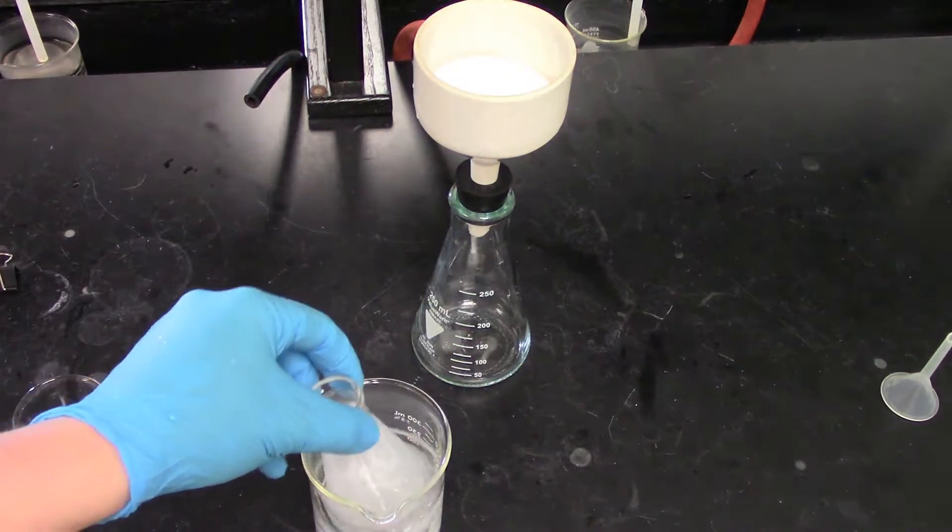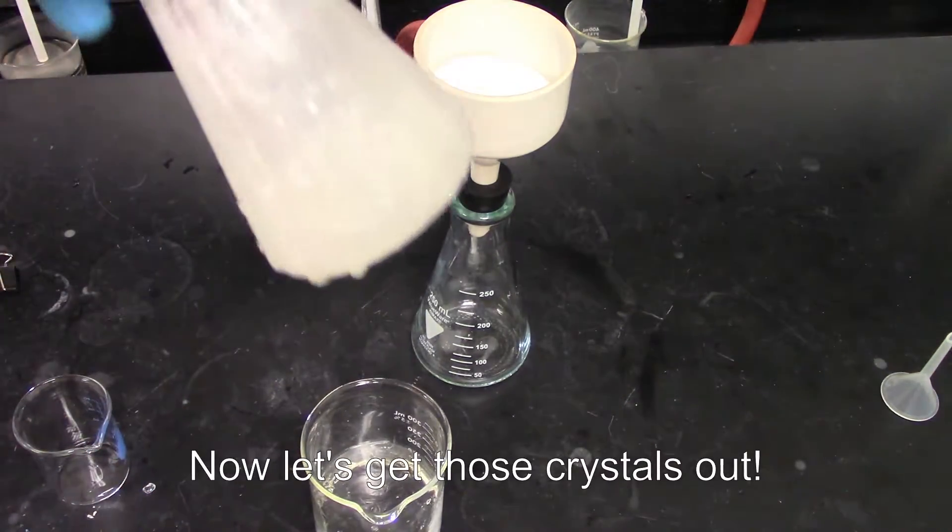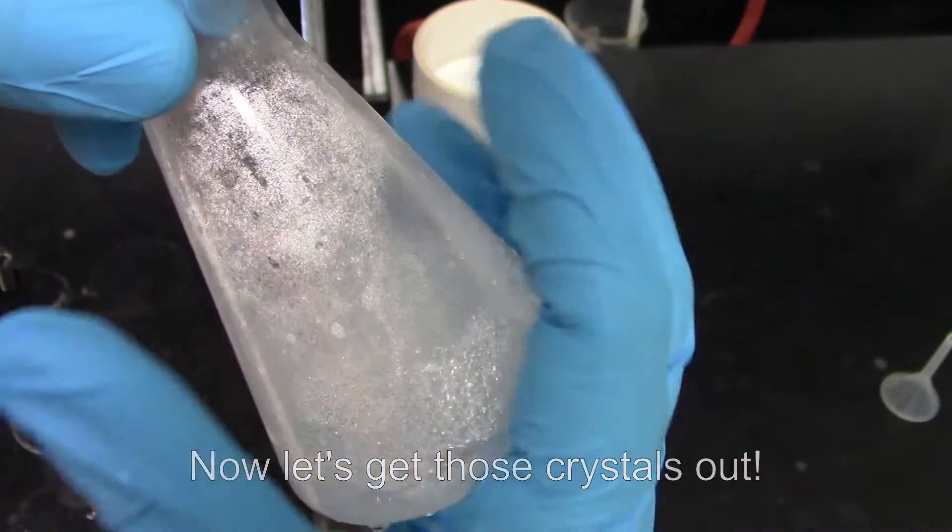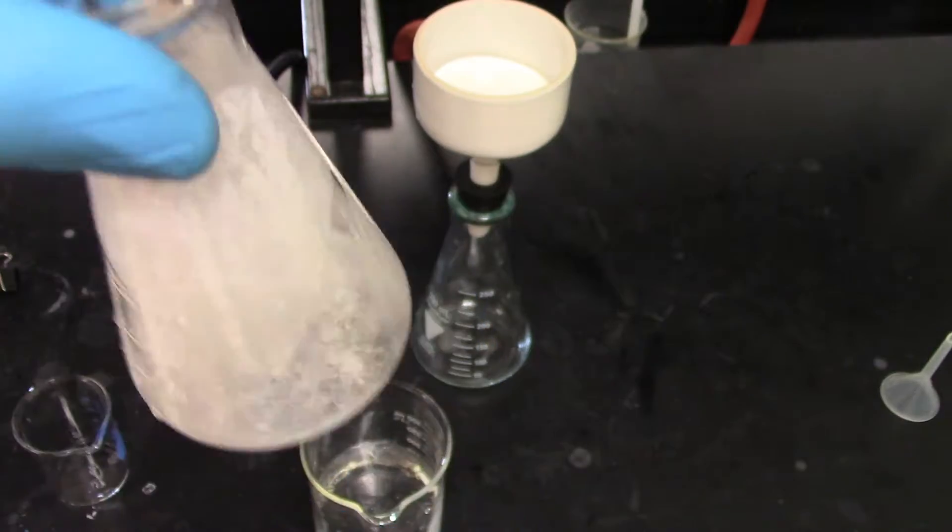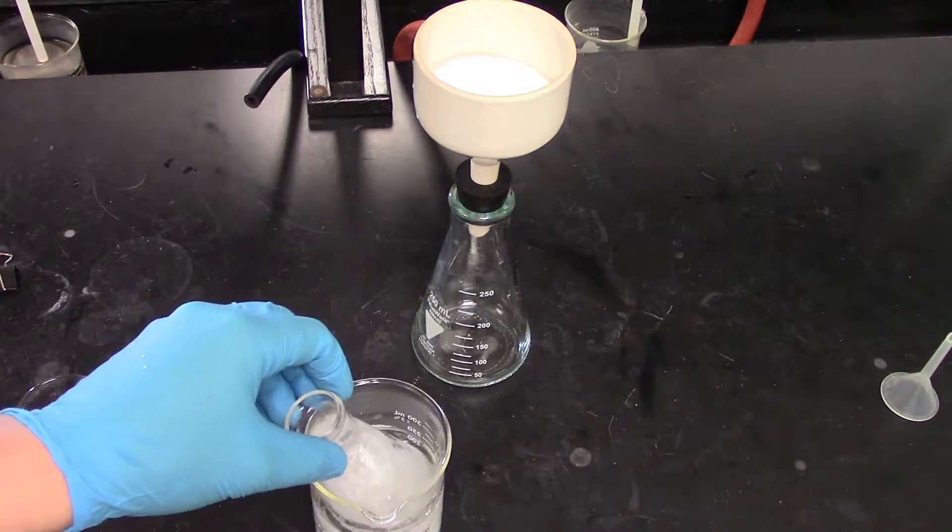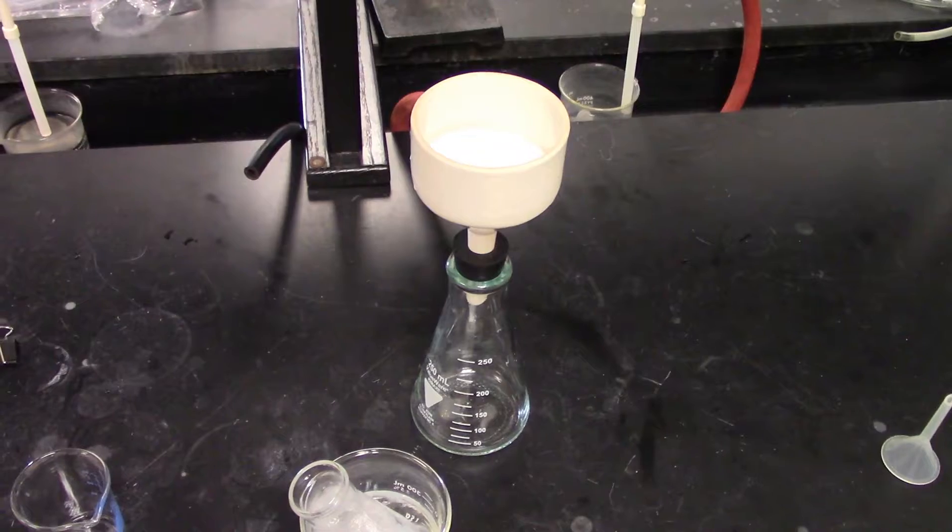All right, so through the magic of editing I managed to precipitate out these crystals. Hopefully you can see in the video here that I've got a nice healthy set of crystals down here at the bottom. Now I'm going to get them out by vacuum filtration. This is very different than the gravity filtration you saw before.